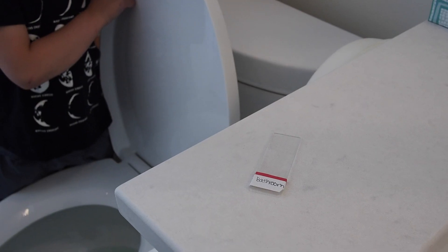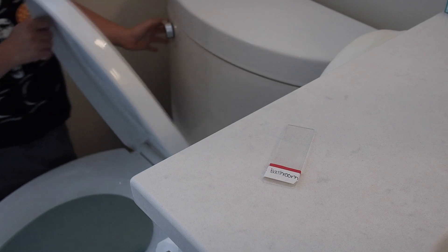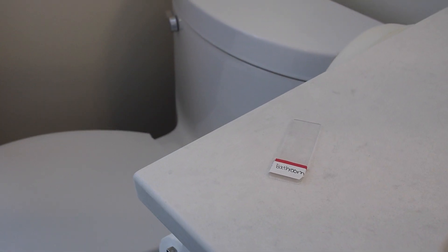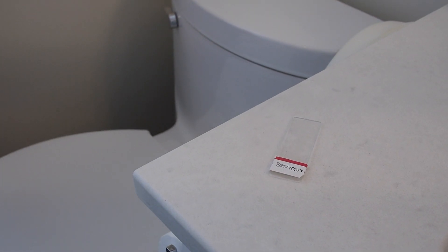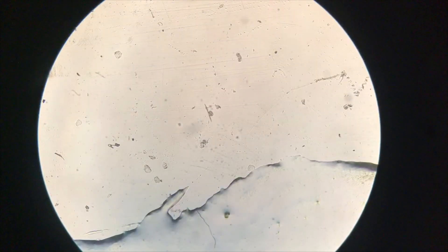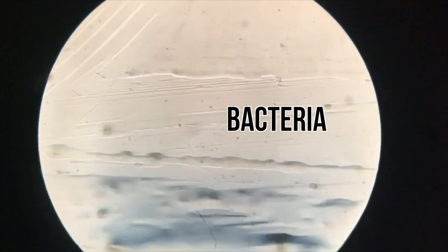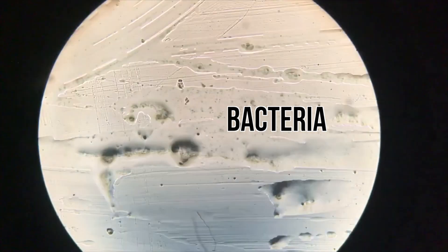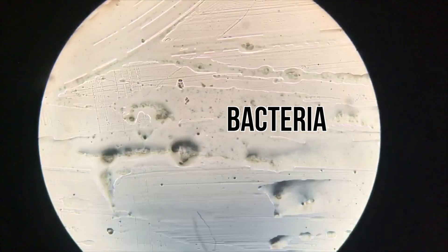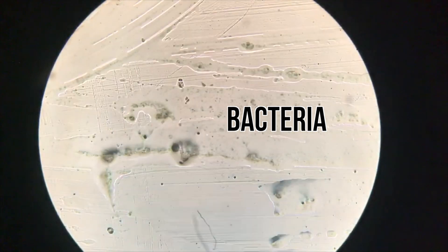Then we headed inside and checked out the bathroom, where we flushed the toilet to see what would collect on the Vaseline. In our bathroom slide, you can see tiny colonies of bacteria. This is a terrifying reminder that you should always close the seat of your toilet before flushing it.